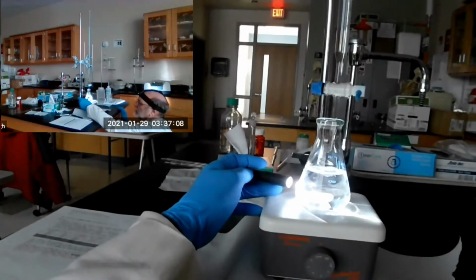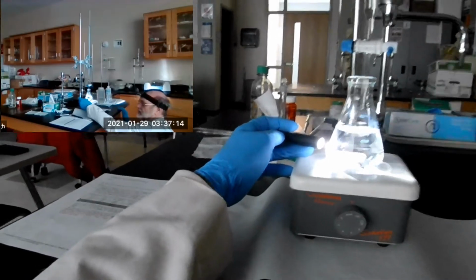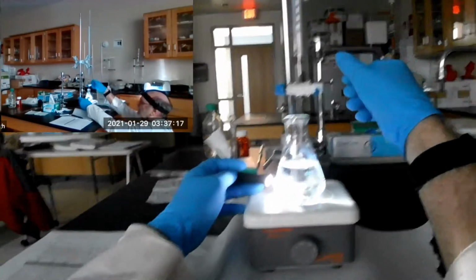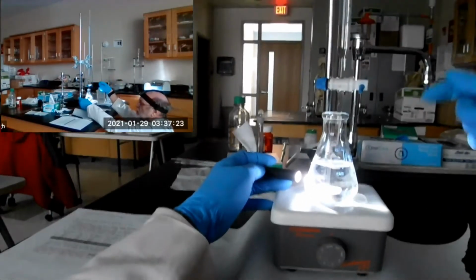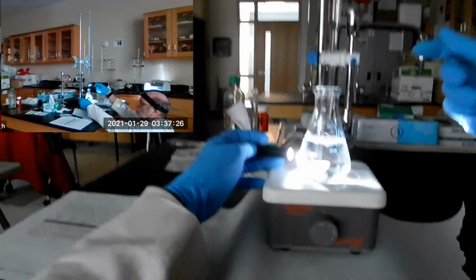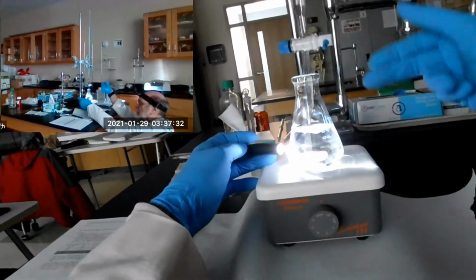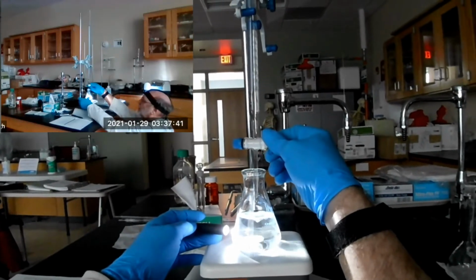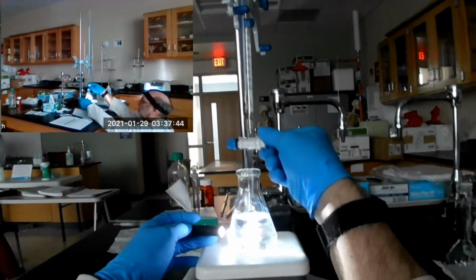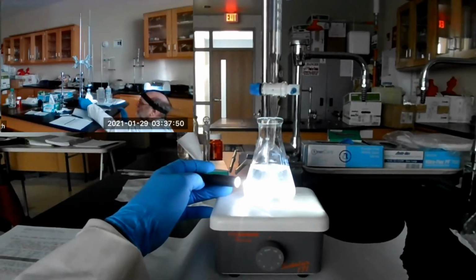And when we reach the end point, the equilibrium then will include silver chloride in the solid form. Right now, there's none because the silver ammonia complex has consumed it. Well, we formed the silver chloride first with the addition of chloride, and then the equilibrium shifted back toward the complex ion. So what we want to do is catch it right at the point where it does that. Okay, you add a little more. What's it going to do? It's consuming it.